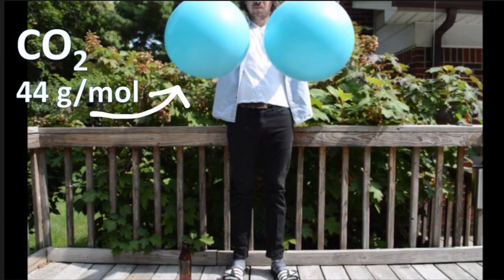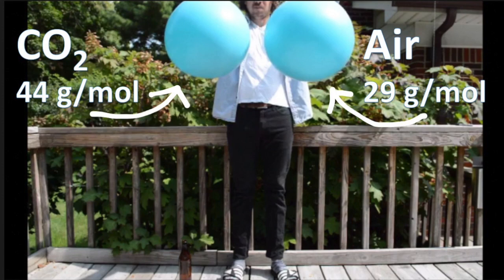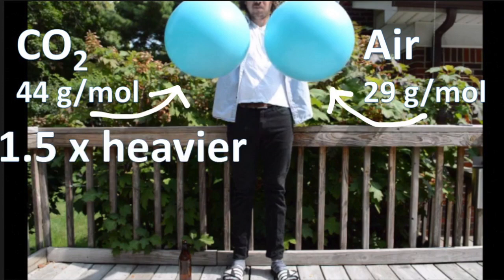This balloon is full of CO2 and this balloon is full of air. The balloon full of CO2 is 1.5 times heavier than the balloon with air. Check out what happens when I drop them.